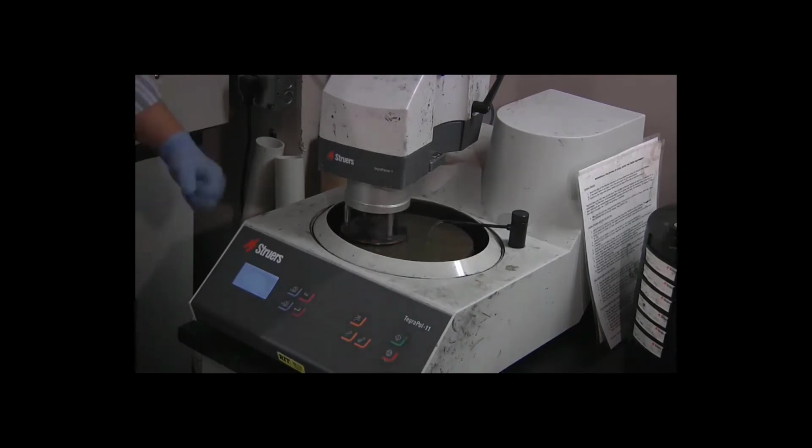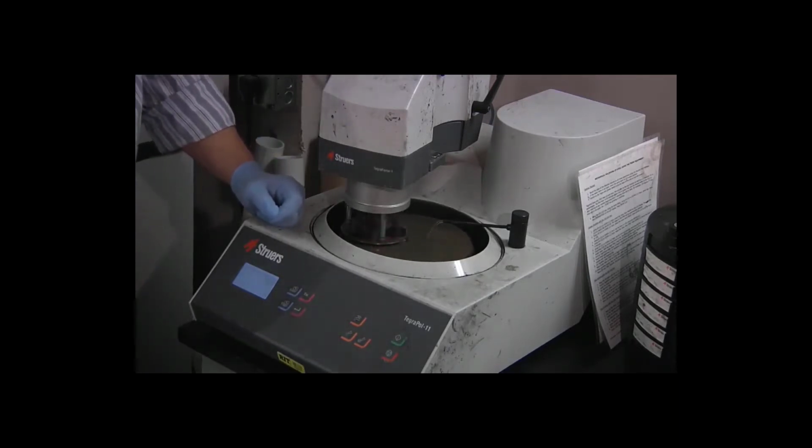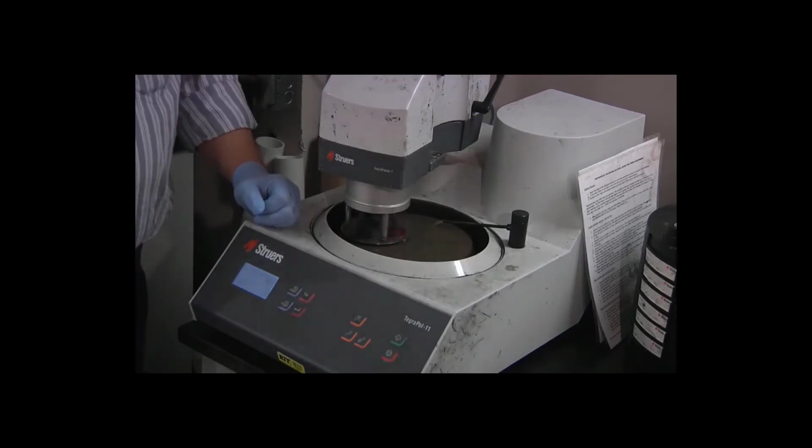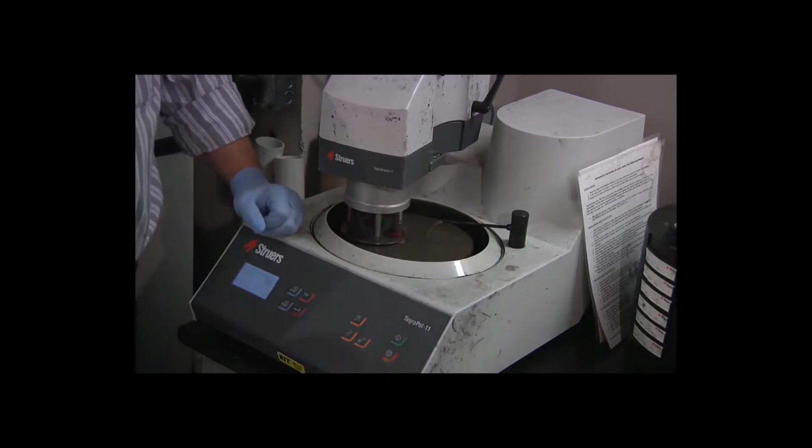Now when the first grinding step completes, we're going to rinse and dry the specimens, and we're going to inspect them. When they first come out of the molding process, frequently there's plastic flash that's covering part of the metal because the surface wasn't perfectly flat. We need to make sure that's ground away. We need to make sure that the metal surface is uniform and that we don't have any large scratches other than the ones from the grinding process itself.